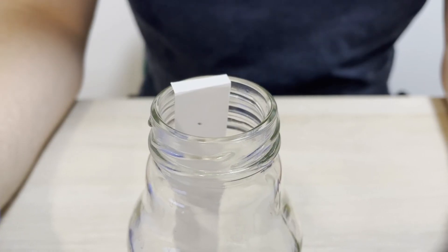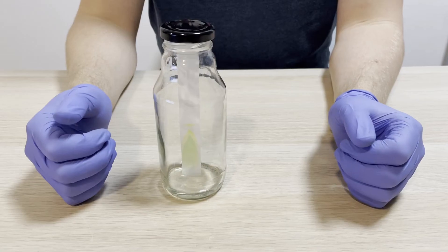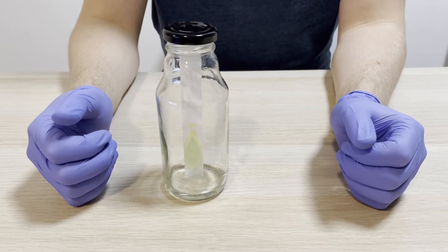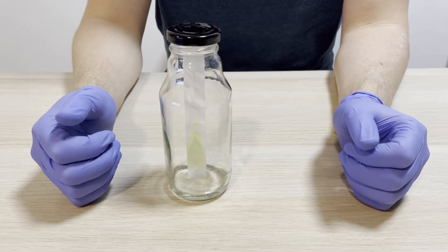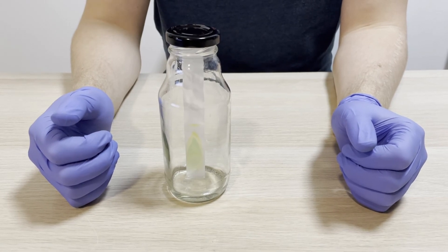In the beginning, you can also bend the paper for better stability. The solvent moves throughout the paper under the capillary effect and dissolves our dry pigment. As it moves up, molecules slowly attach to the paper in dependence on their solubility in the solvent. Even after a couple of minutes, you will see the separation. Wait approximately 10 minutes until the upper phase reaches the finish point.